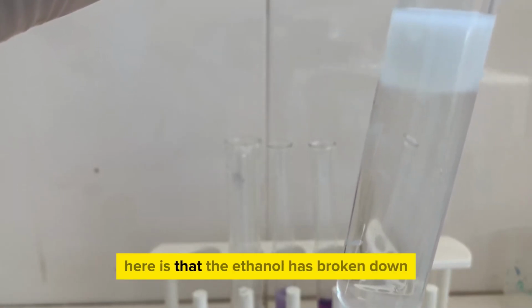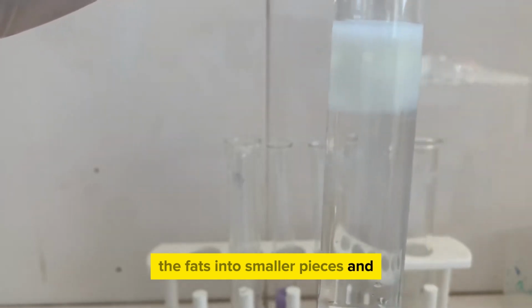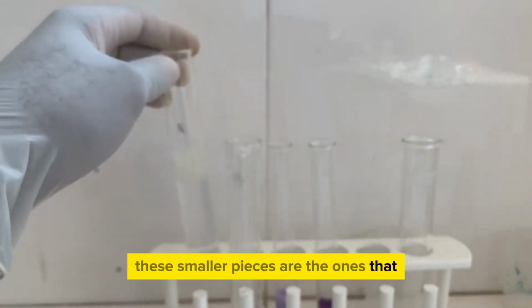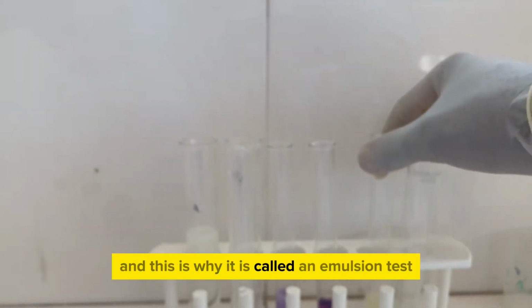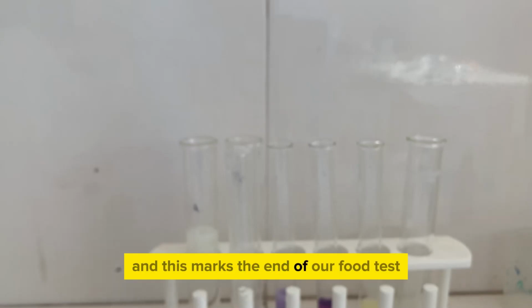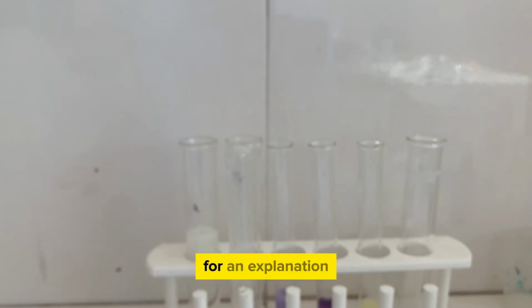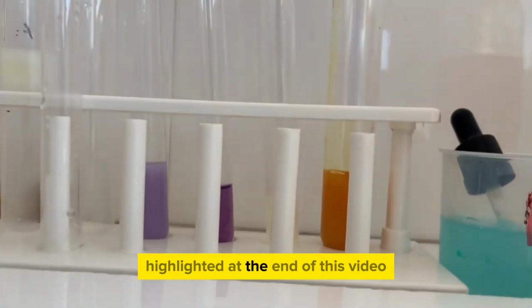So what has happened here is that the ethanol has broken down the fats into smaller pieces, and these smaller pieces are the ones that form that cloud or that emulsion, and this is why it is called an emulsion test. So there we have our 3 tests which we did, and this marks the end of our food test. For an explanation of why these tests are happening like this, to explain these results, please watch our other video highlighted at the end of this video.